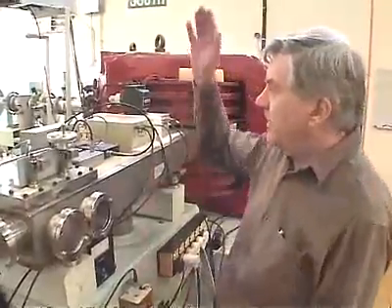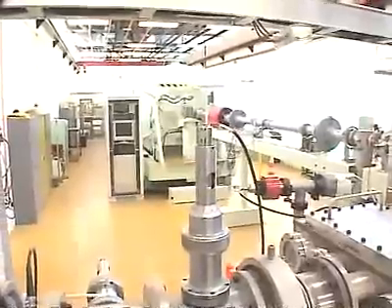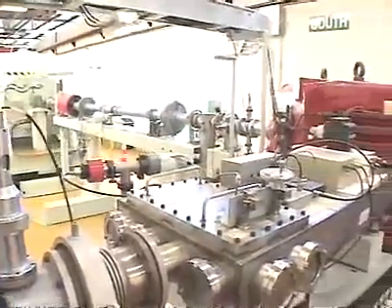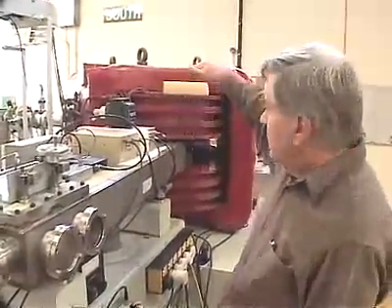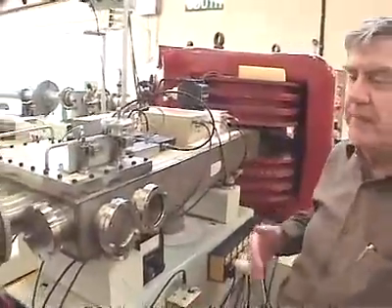Well, here we are at the main magnet after the accelerator. Our carbon atoms are coming from the accelerator, which is in that large green tank down there, and they're travelling down the grey tube at something like 6% of the speed of light. When they come into the magnet, their path gets bent. So instead of staying in a straight line, they get bent through 90 degrees and travel towards us here.